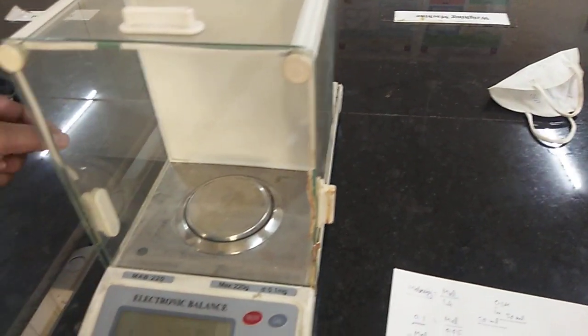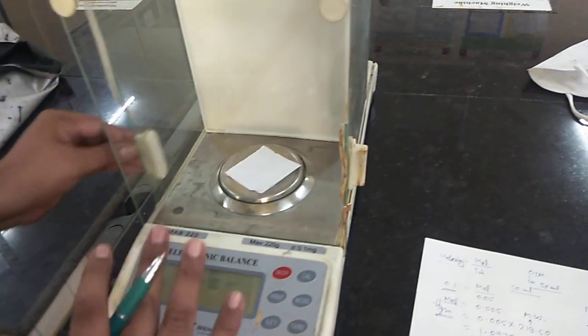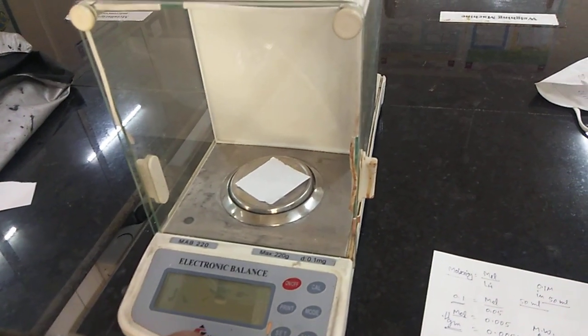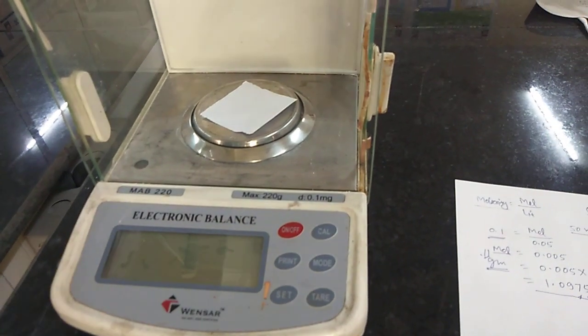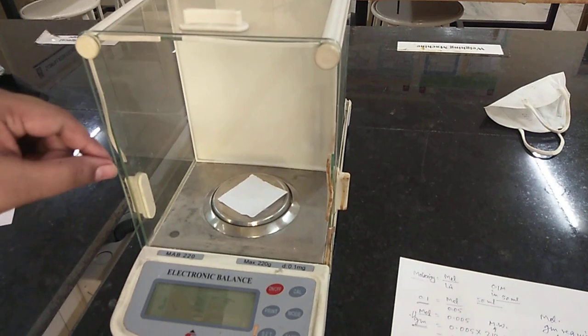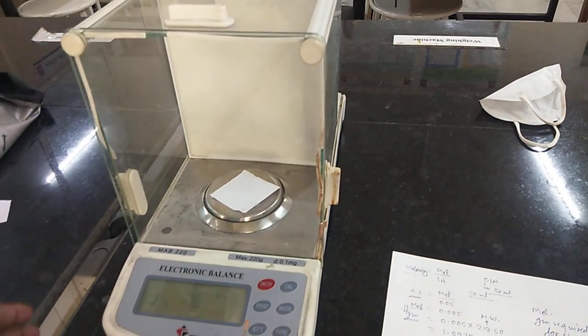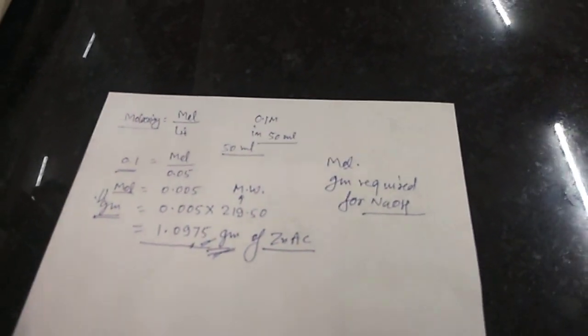To use the weighing machine, turn it on using the on/off button, then place a filter paper or white paper inside. Wait until the reading is stable, then press tare to zero the balance. Whatever you add with the spatula will then be the exact amount of solute. Since this process takes time, I have already pre-weighed the zinc acetate and the specific amount of NaOH.